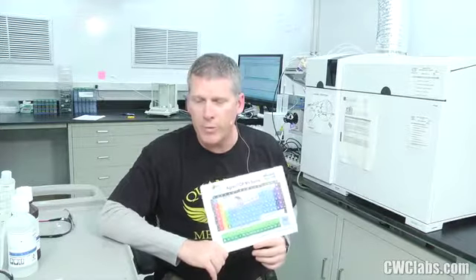I call this the polyatomic overlay interference with the internal standards, causing the apparent reduced concentration of the analytes in your samples.